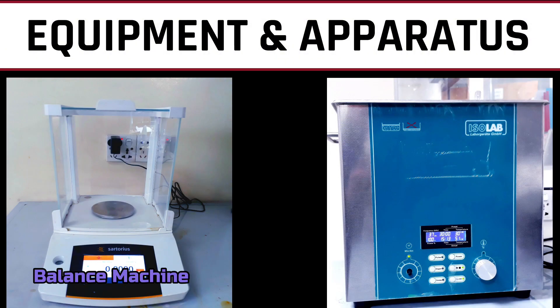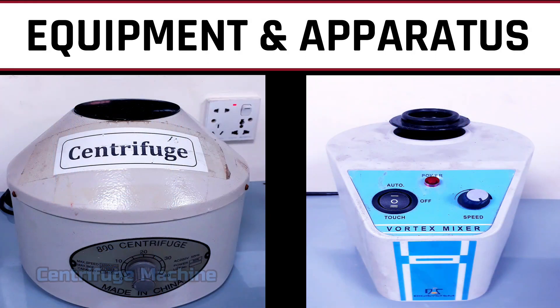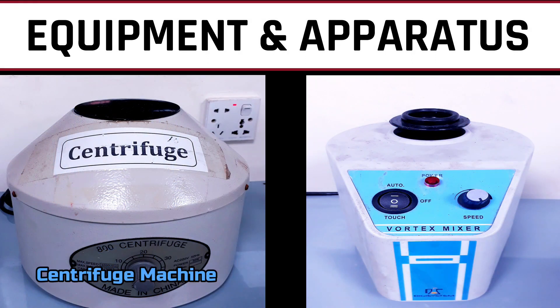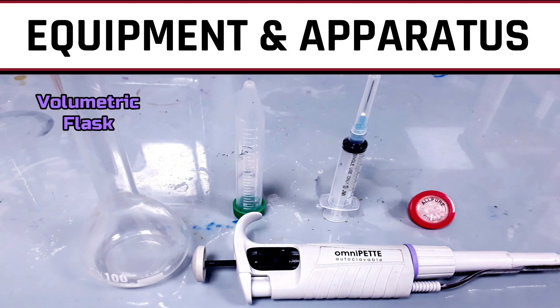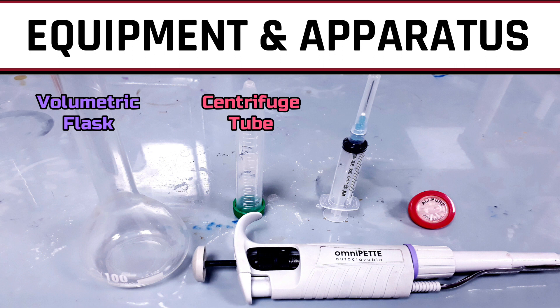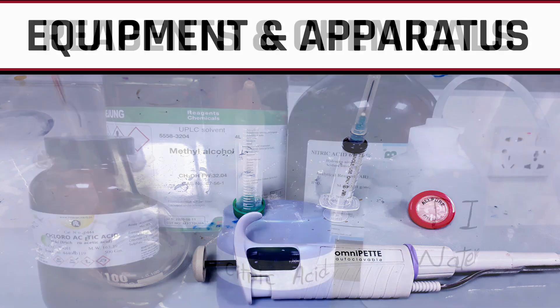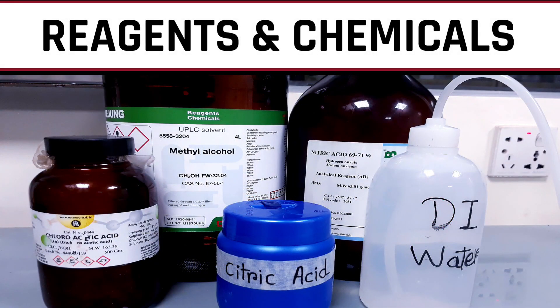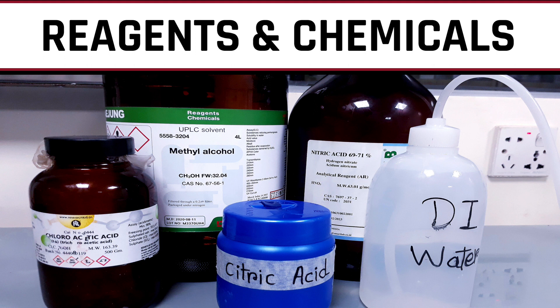For this procedure we need a balance machine, sonicator bath, centrifuge machine, vortex mixer, volumetric flask, centrifuge tube, pipette, syringe with filter, methanol, nitric acid, citric acid, trichloroacetic acid, and deionized water.